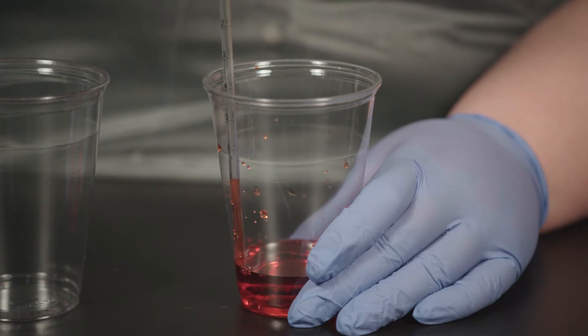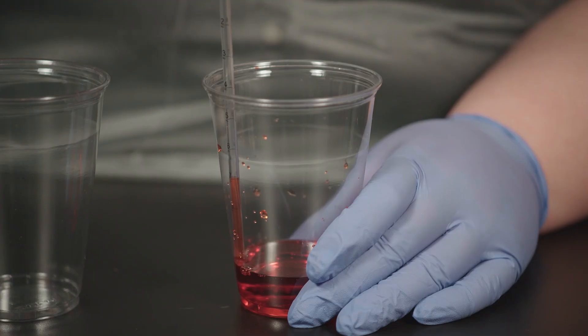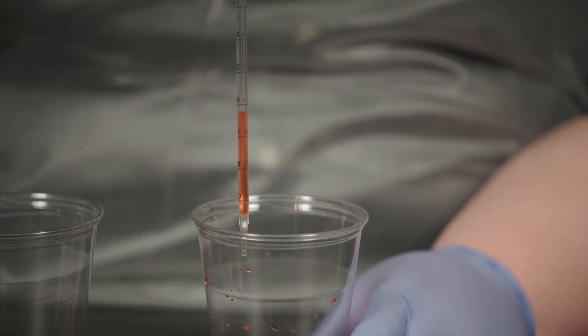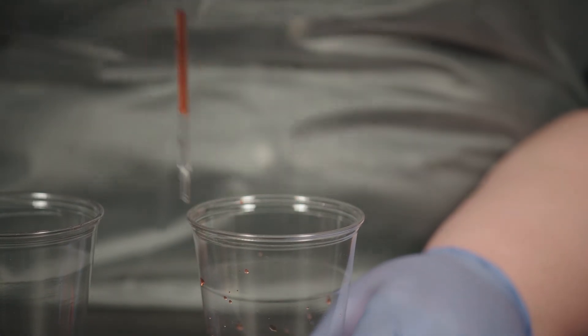If I want to pull a small volume into the pipette, I'll squeeze the bulb just slightly to create a little suction. I draw up the amount I want, then I can remove the pipette from the liquid. If some air comes up into the pipette tip, that's all right because I know how much liquid is in the pipette.